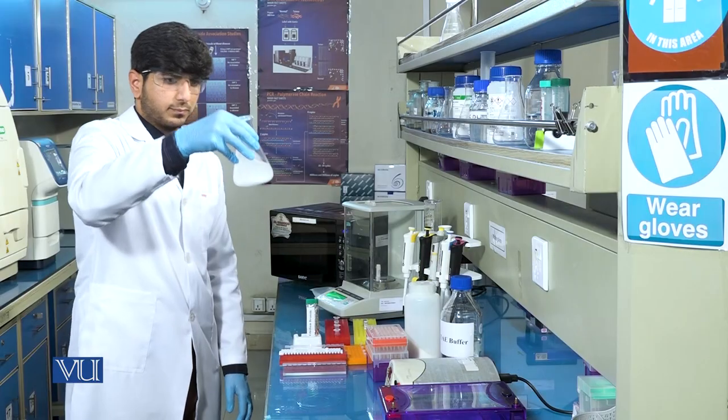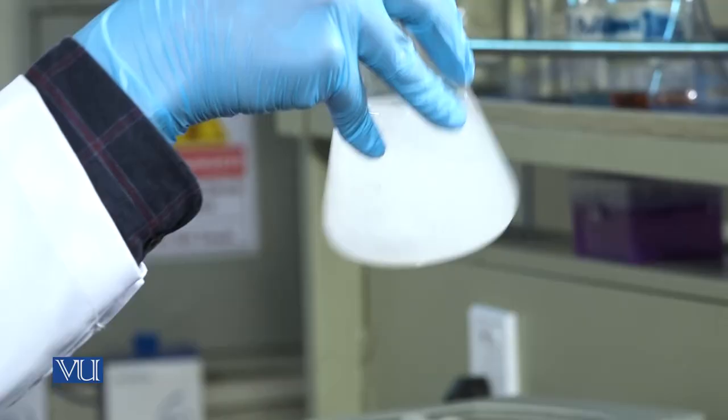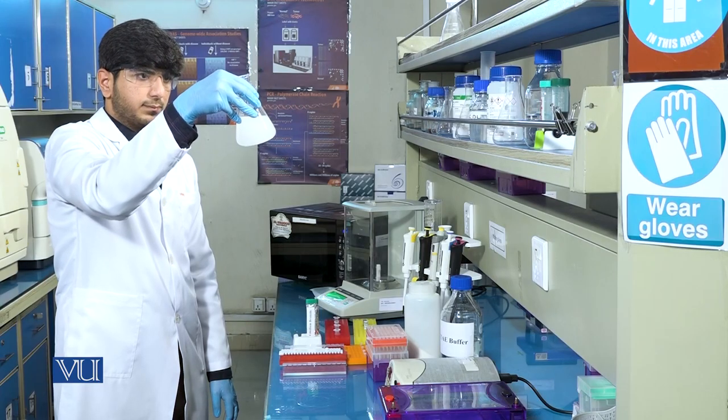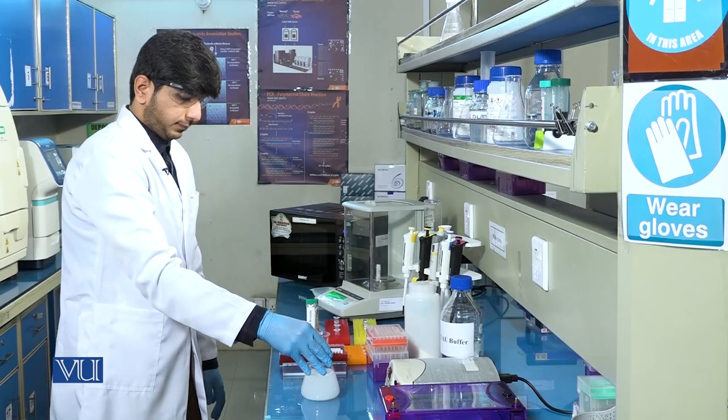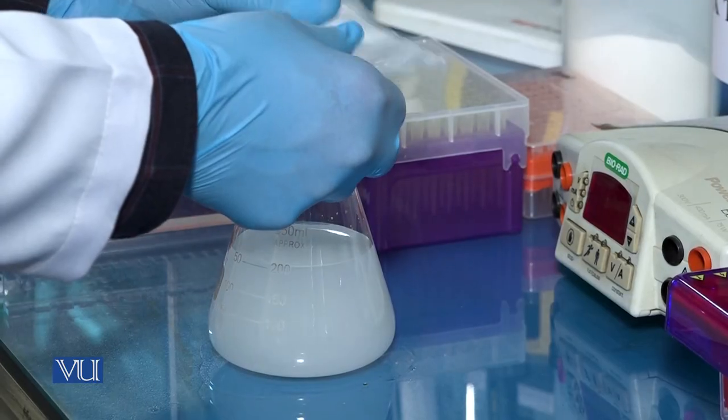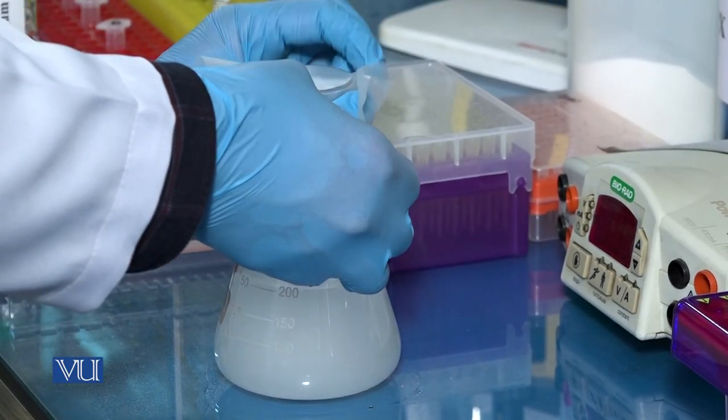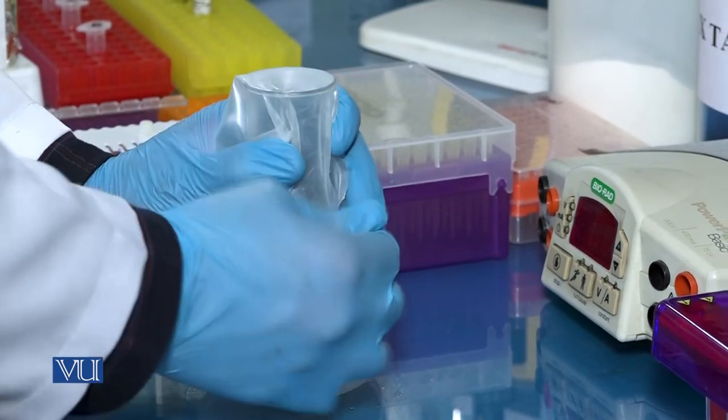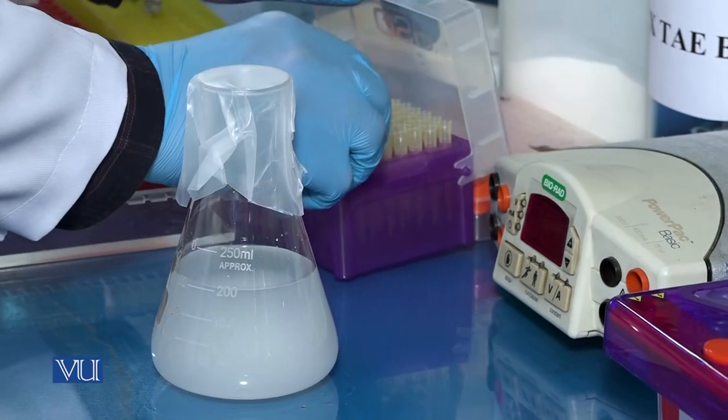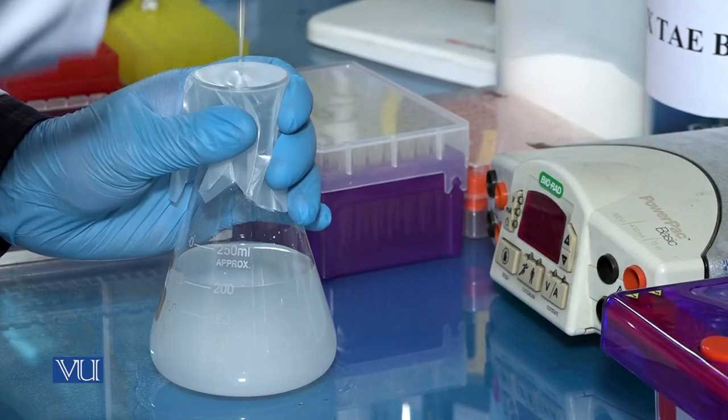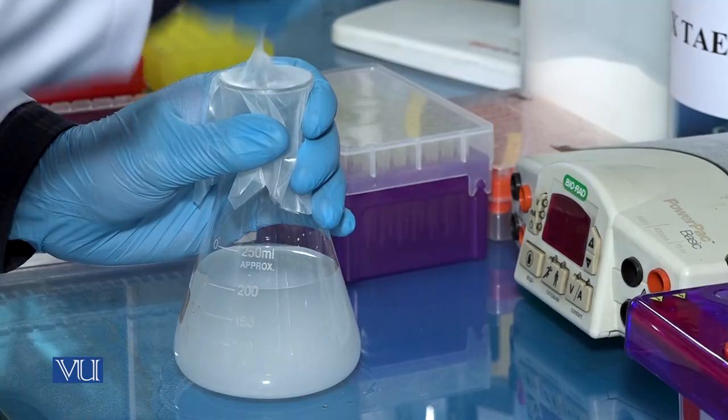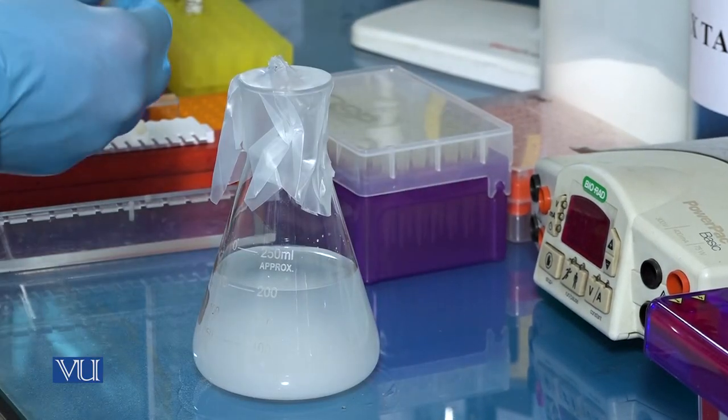Mix the flask contents well and put in the oven for 1 to 2 minutes.